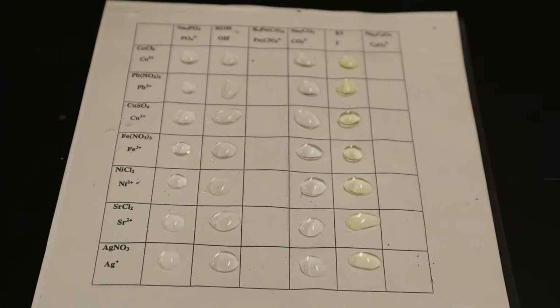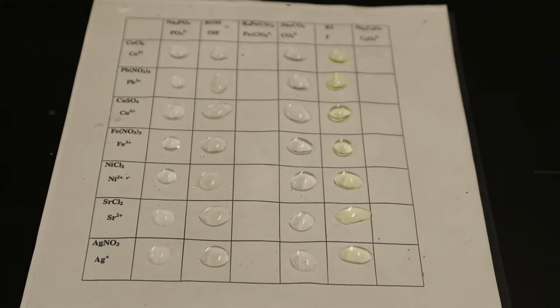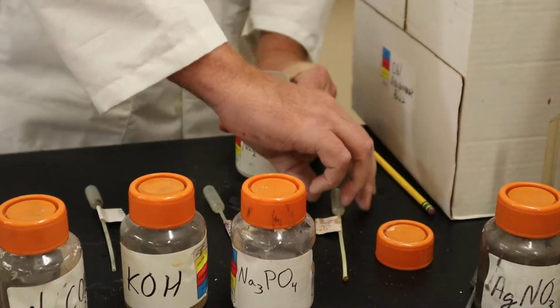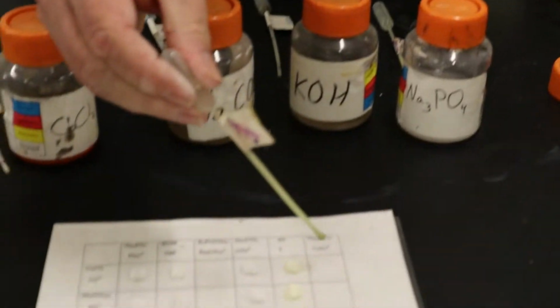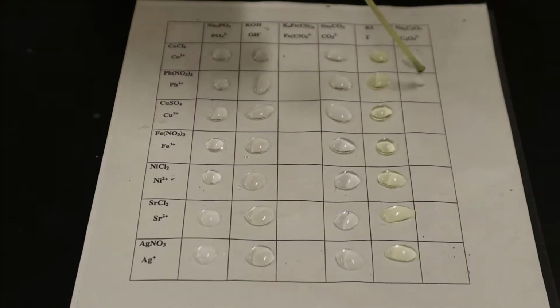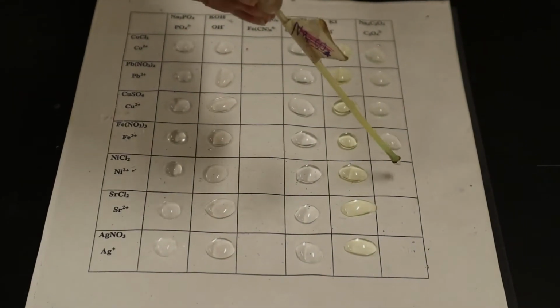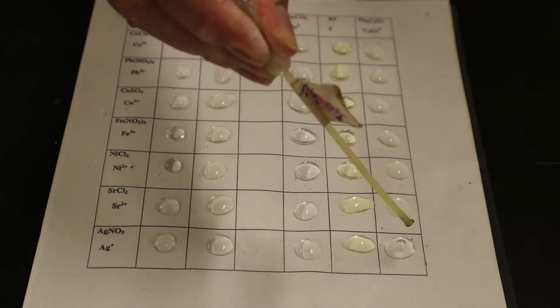Dark. Sodium oxalate, right? C2O4, is that oxalate? Yes, right there. Thank you. This is not one of the ones we have to memorize. Well, maybe Honors does. I make them. Yeah, they hate that one. Well, they're good this year. They just have their list in front of them. Yeah, that's what I'm doing too.